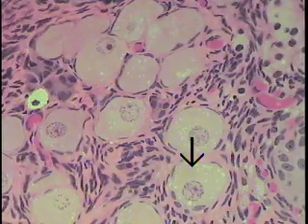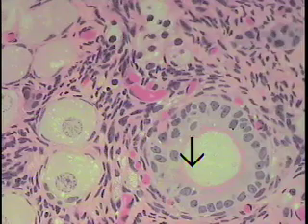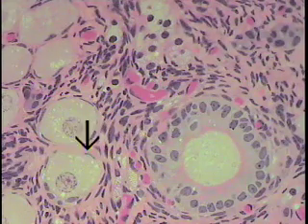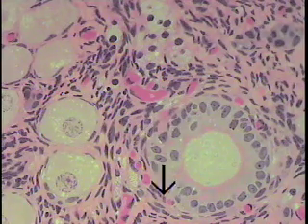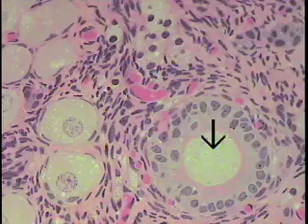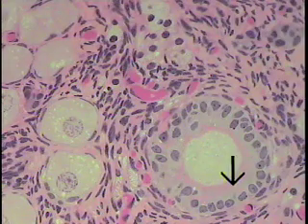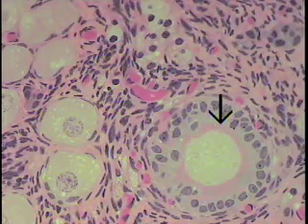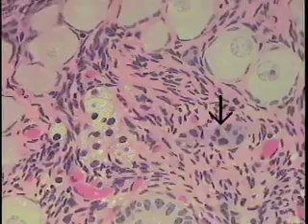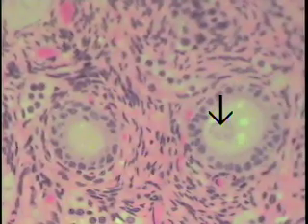This is another field of primordial follicles, and as one courses this way, we run into a growing follicle called a primary follicle — it's beginning to grow. Notice that the follicular cells have begun to proliferate, round up, and become cuboidal in shape. We're just nicking the cytoplasm of the oocyte contained within this follicle, and one can see a little pink membrane here — a zona pellucida, a thin homogeneous membrane, is just now being produced and laid down.